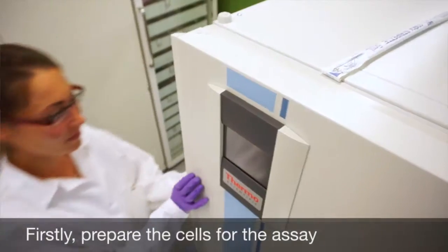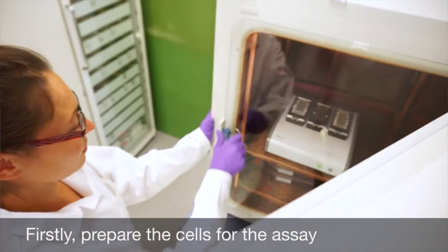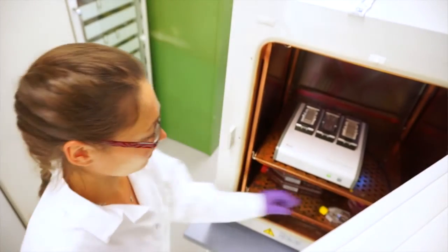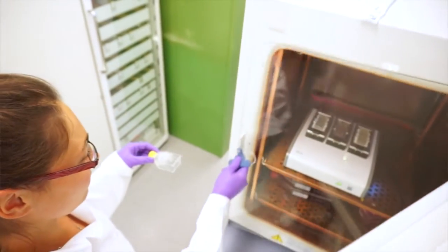First, prepare the cells for your assay. Detach your cells as usual using either an enzymatic or a non-enzymatic procedure.